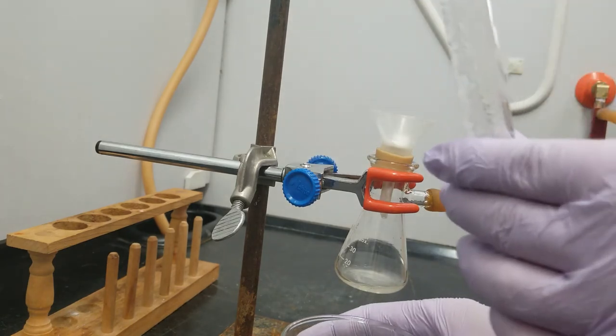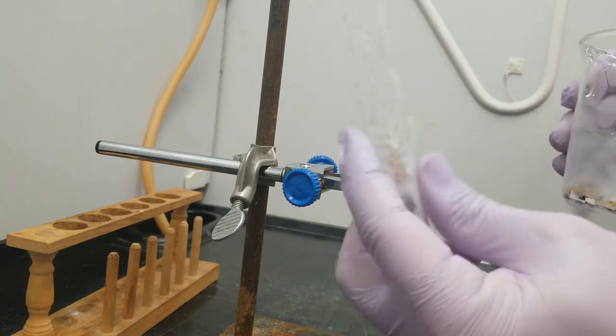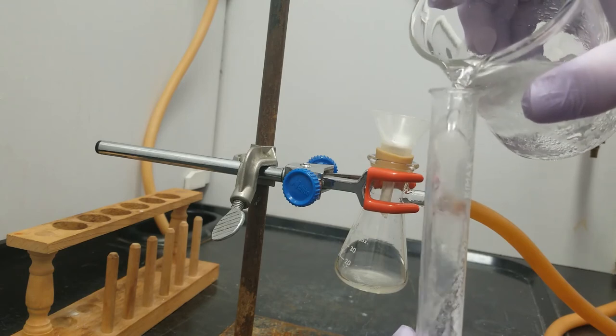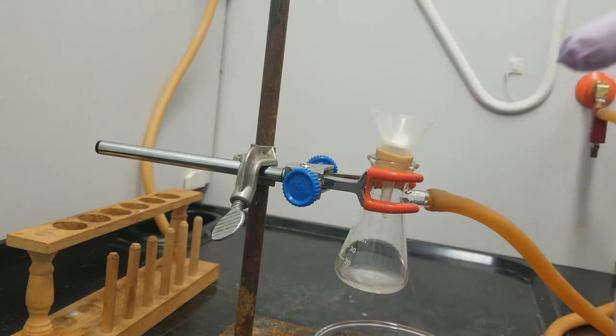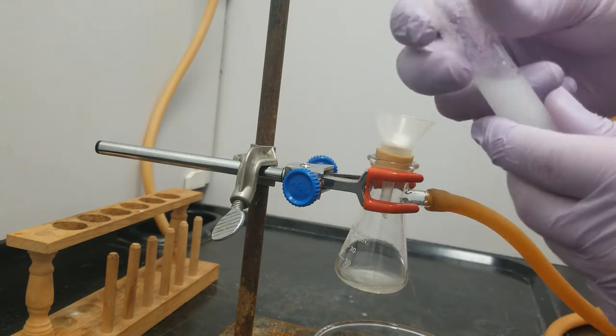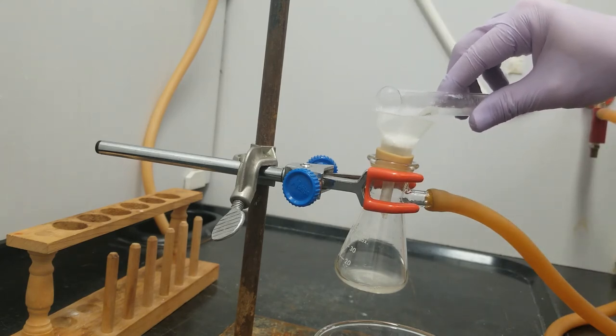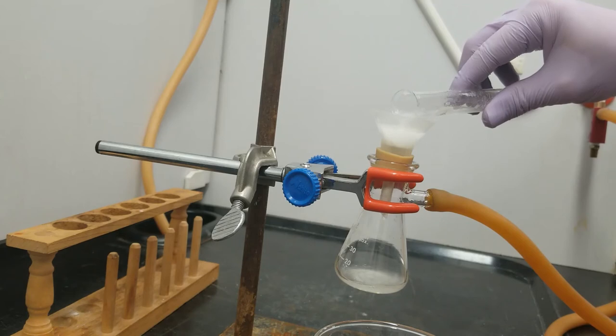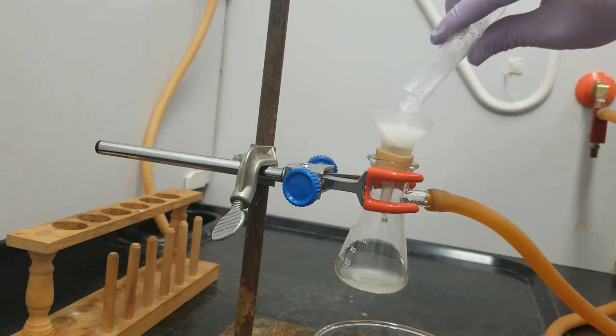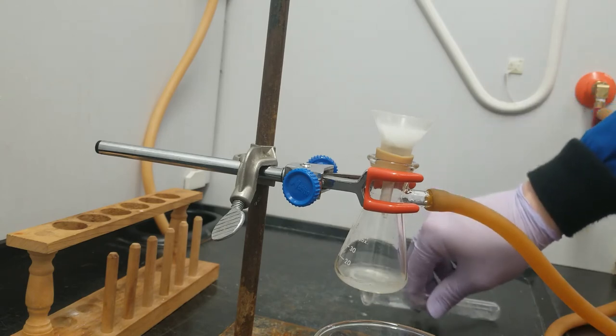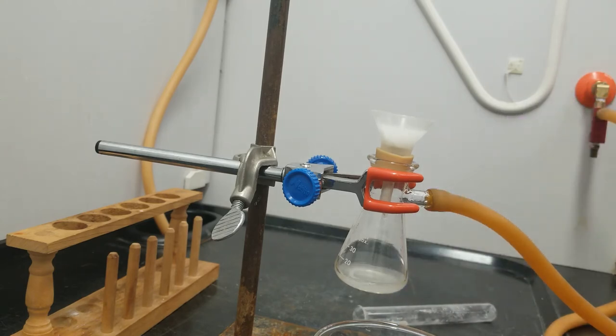I'm going to go ahead and rinse out all of the stuff stuck to the side of my test tube by just adding a little bit of ice water. Okay. Test tube is much cleaner now. So I've gotten most of my products out.